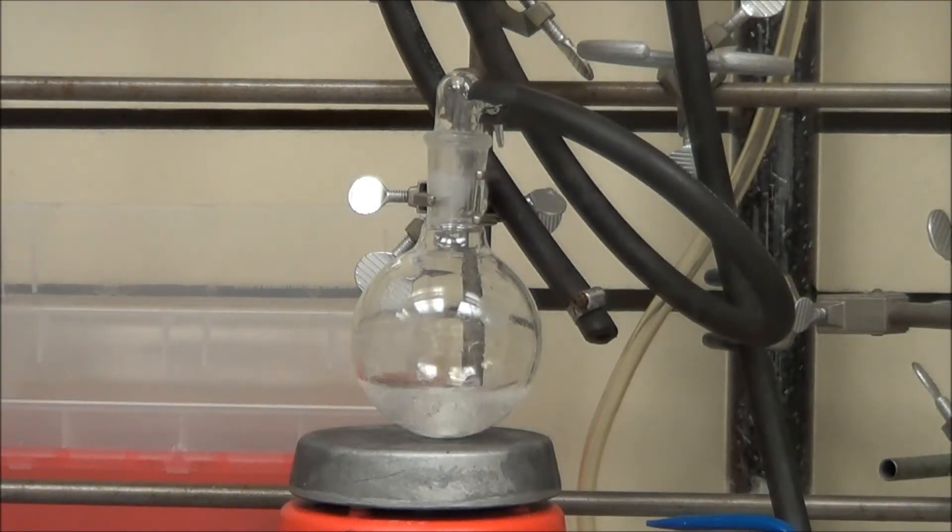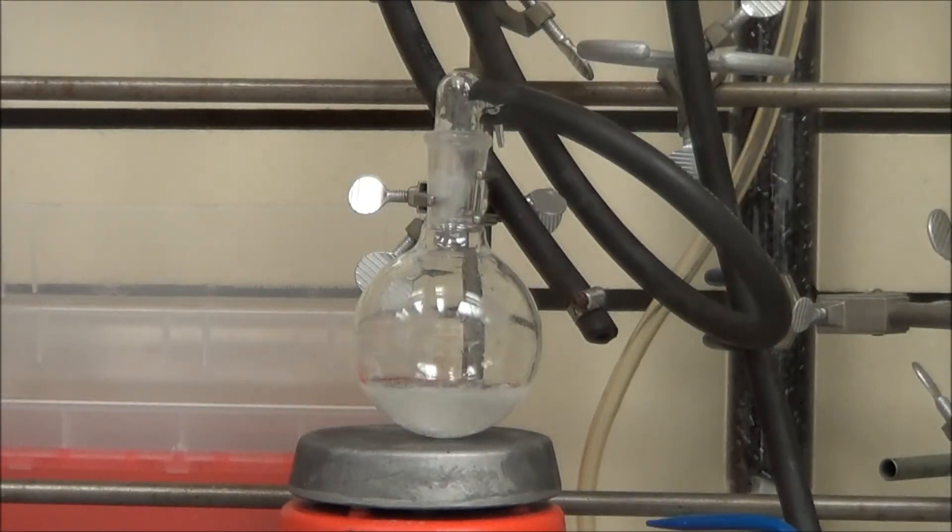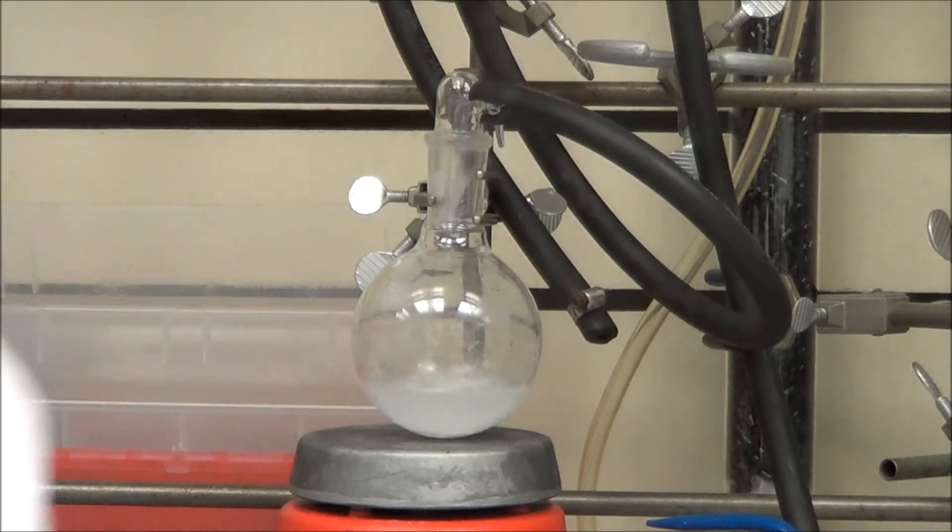If you do it in anything else, your oleic acid is going to go bad very, very quickly. And you kind of wasted your time. And here we hit vacuum. And you can see the last of the acetonitrile coming out.